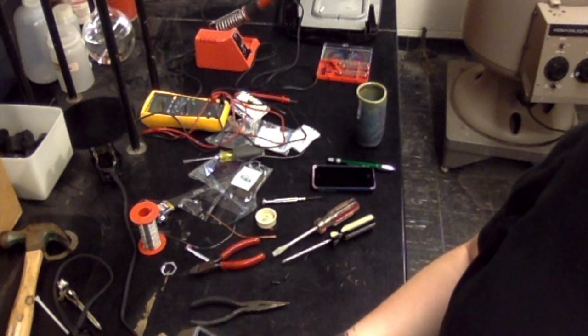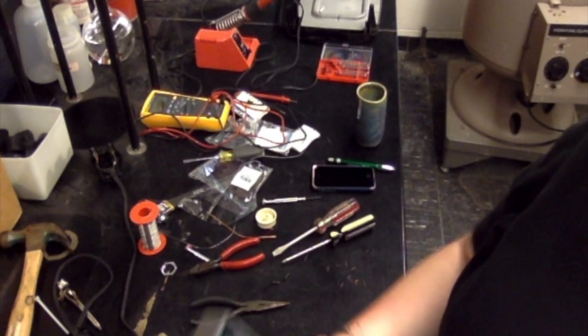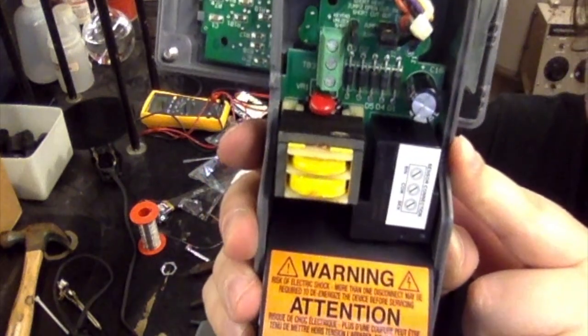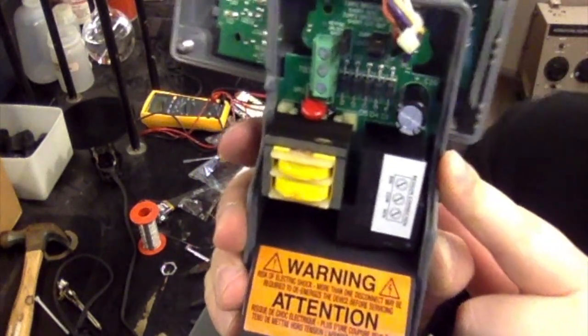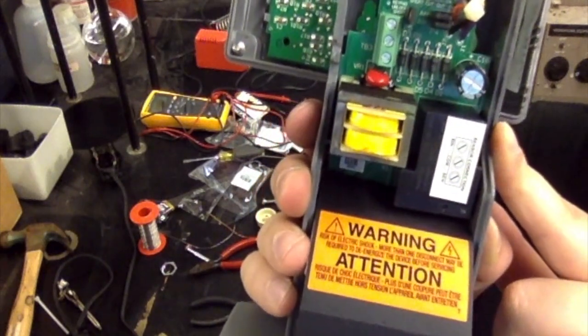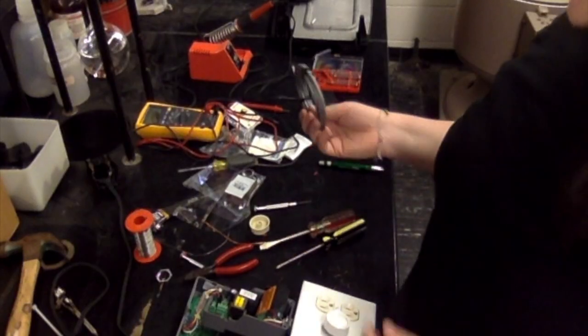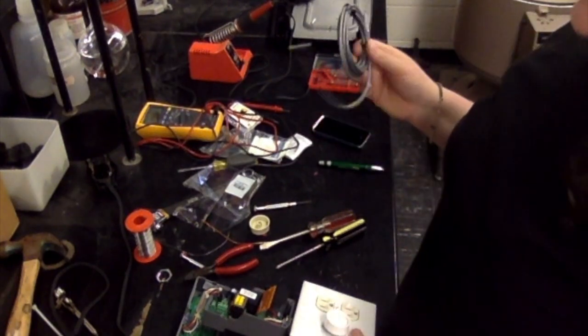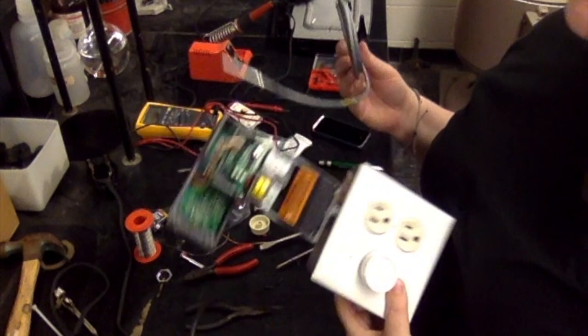And again, you want to be gentle with this because obviously if those prongs get bent, that's going to be a problem. Okay, so this is the new configuration. You probably can't tell any difference, but you'll see there's no prongs on the right that aren't covered. All 4 of those are covered. Okay, so the next thing we need to do is to attach the thermocouple to the A419.